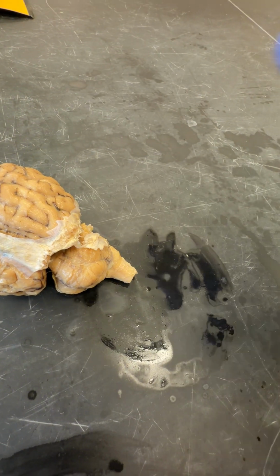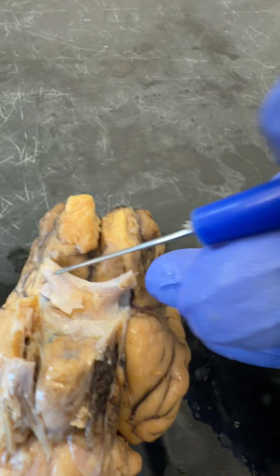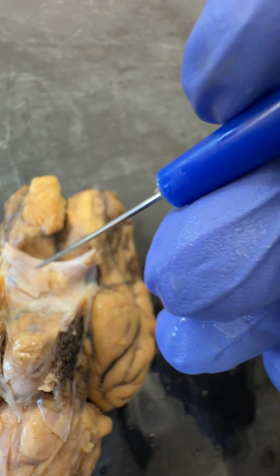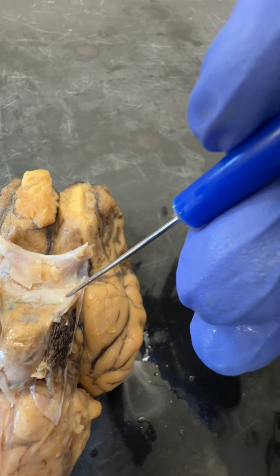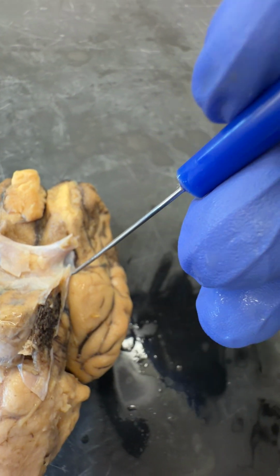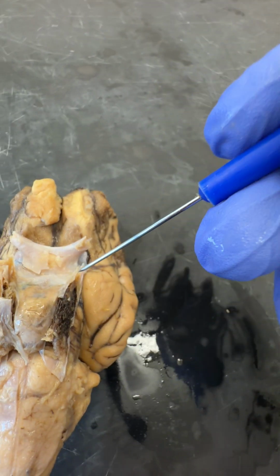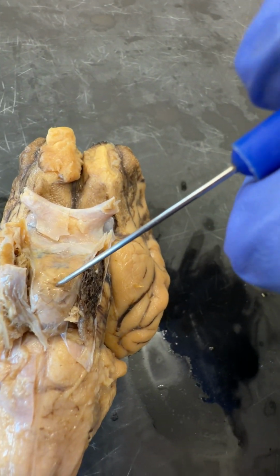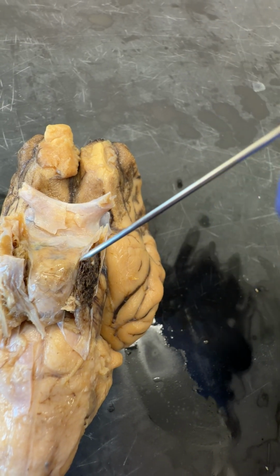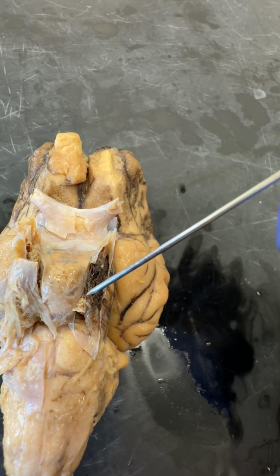All right, the hypothalamus we'll see later. The optic chiasma is here, and it's where the two optic nerves meet and cross. And then it's underneath the dura mater here, but leading from that is the optic tract that leads down into the brain. And actually, the optic tract is part of the brain. The infundibulum is what the pituitary gland attaches into. So this is the pituitary gland or the hypophysis, and underneath that would be the infundibulum. We'll look at that a little bit later as well.